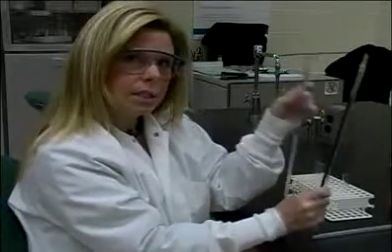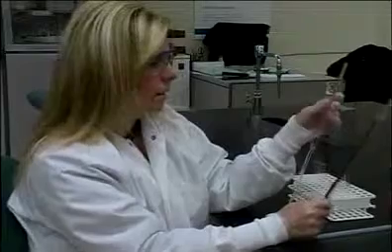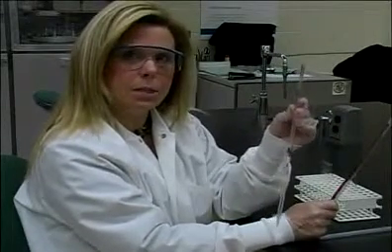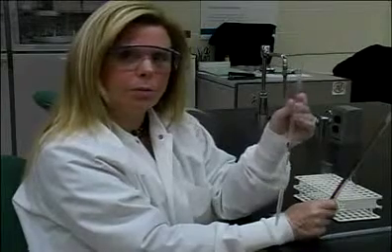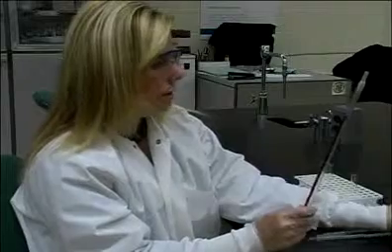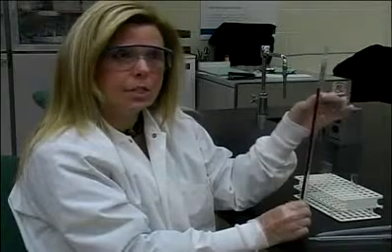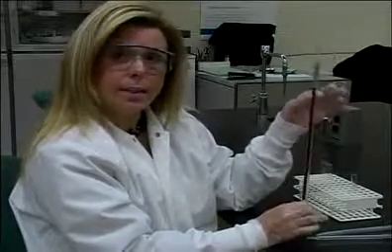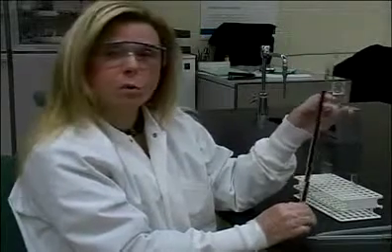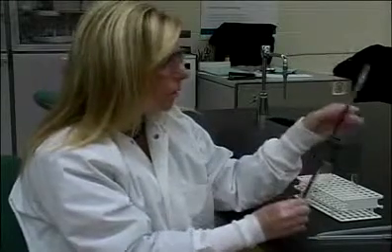We use these in different ways. These volumetric pipettes are used for critical measurements. They're used for making up calibrators. They're used for making up controls. Whereas the serological pipette is used for less critical measurements, the actual transferring of liquids into a test tube. Not to say that the measurement is not critical, but to say that it is not as critical as a volumetric, as in controls and calibrators.